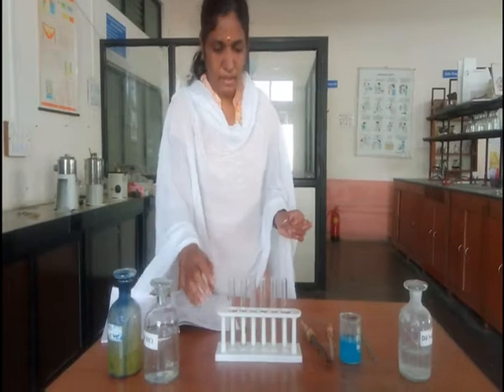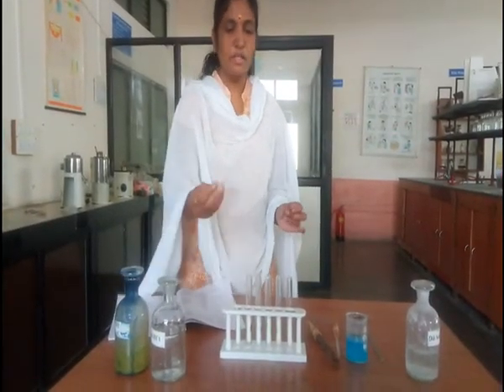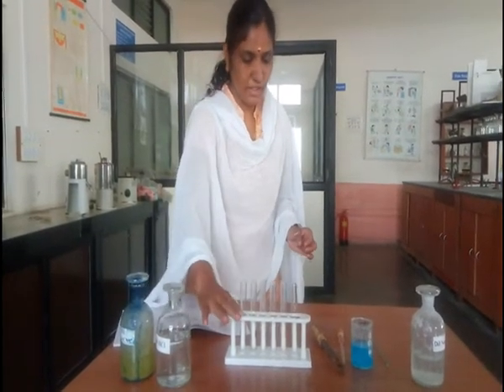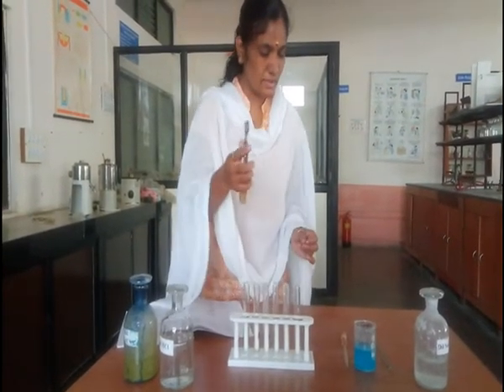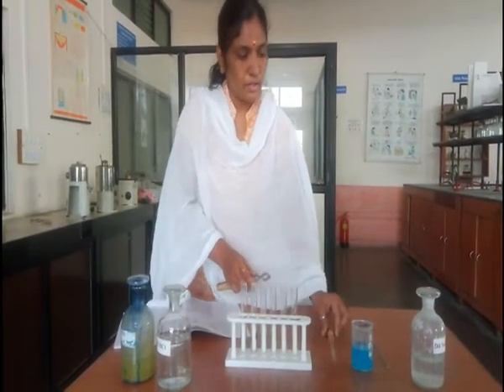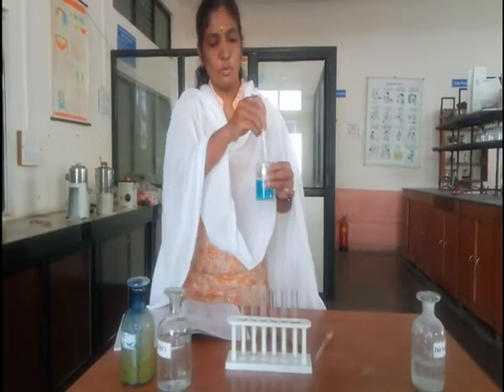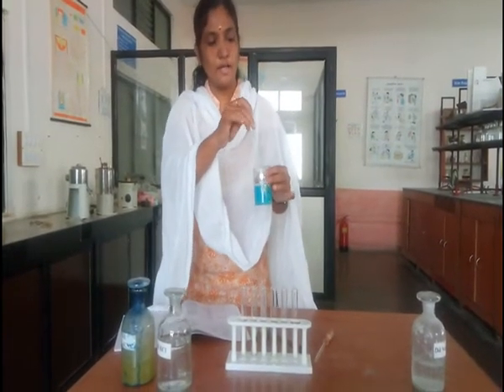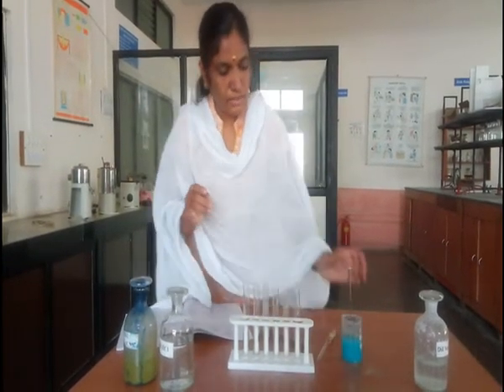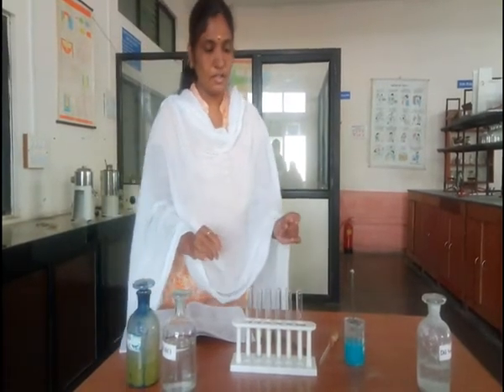Today we are going to use the glassware and equipment — that is the test tube and the test tube holder. This is the unknown solution which is given to you — from this unknown solution you have to find out the cation, the positive ion.